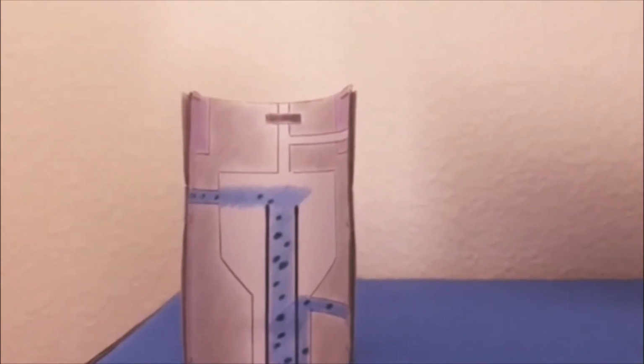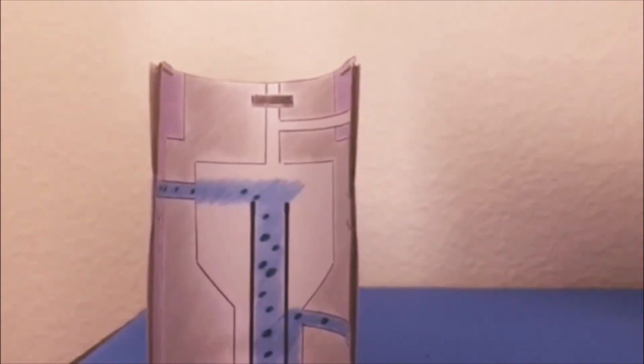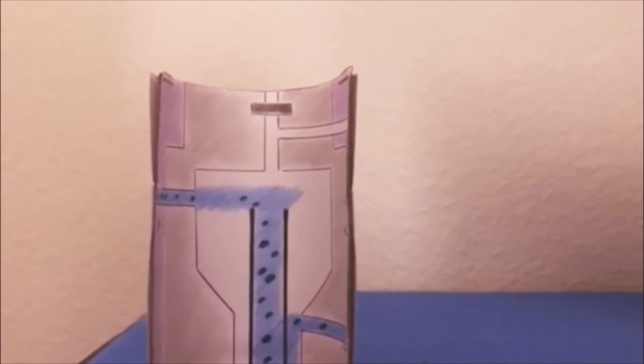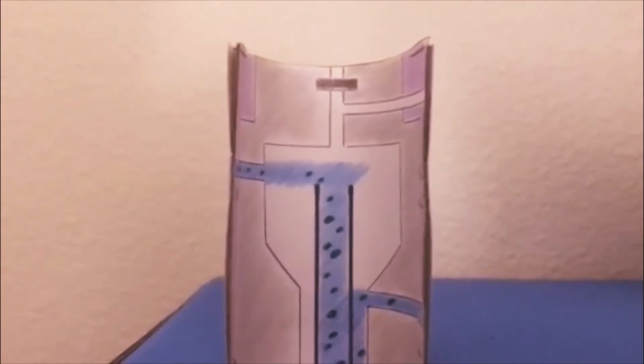The sample is first injected through the injection port. The volume of the sample injected is very small. Once the sample enters the injection port, it will be brought into the gas phase because the injection port is held at a very high temperature.